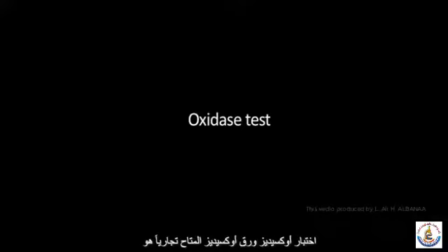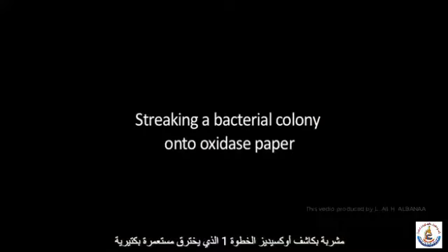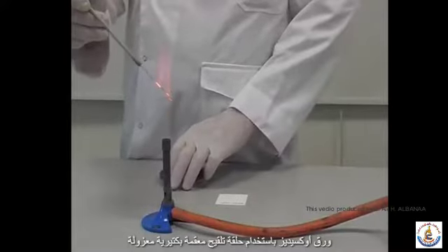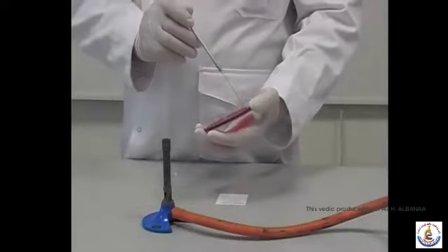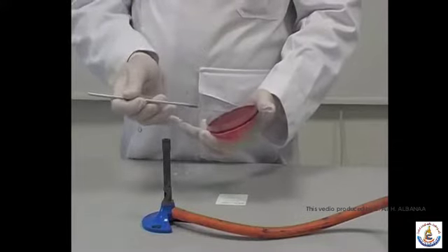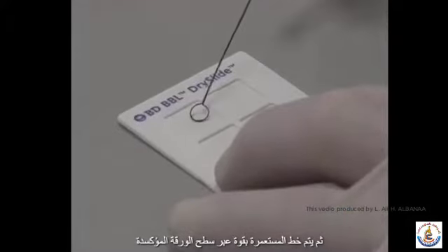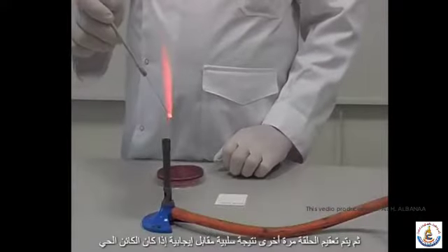Oxidase test. Commercially available oxidase paper is impregnated with the oxidase reagent. Step 1. Streaking a bacterial colony onto oxidase paper. Using a sterile inoculating loop, an isolated bacterial colony is removed from an agar plate. The colony is then streaked firmly across the surface of the oxidase paper. The loop is then sterilised again.